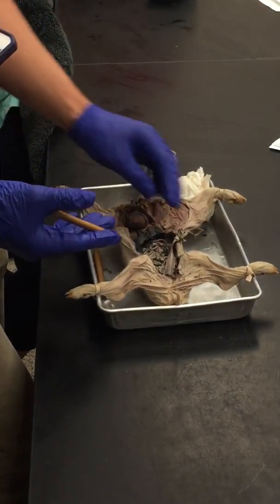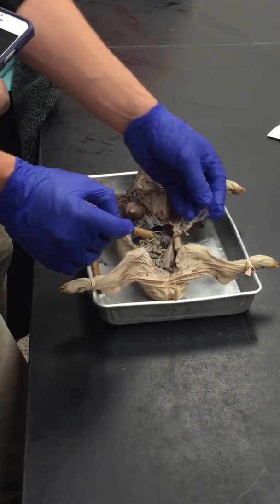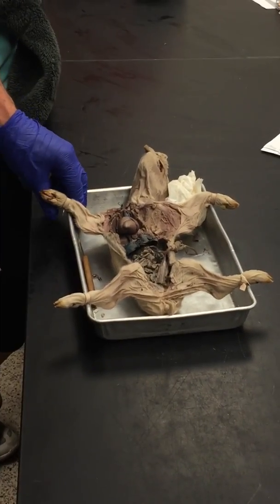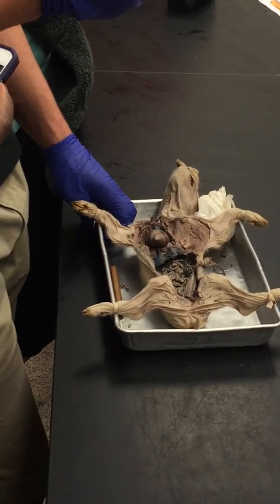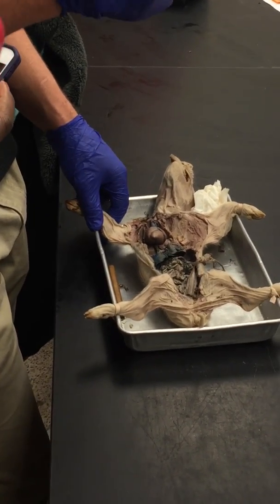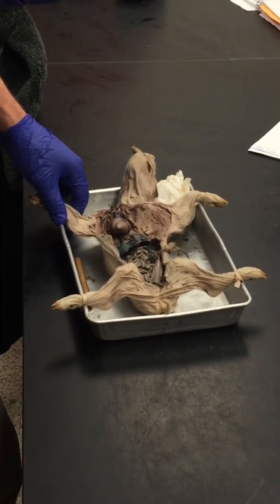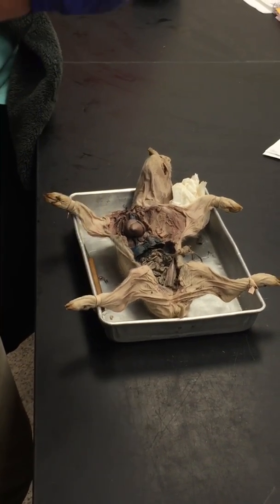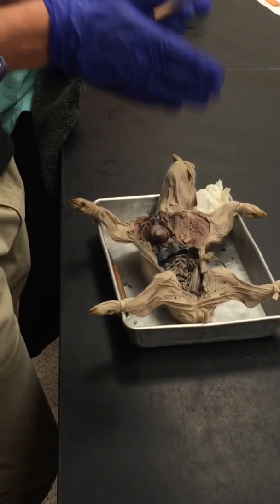So for the fetal pig, for the most part, if you can recognize the umbilical cord, umbilical vein, umbilical arteries, urinary bladder, and then just understand what the ligamentum arteriosum is with the ductus, and what the ligamentum arteriosum is, what it used to be, as in the ductus arteriosus, then understand what the ductus venosus does. And all of that should be on the back page of your worksheet. It should explain what it turns into and what its job is. So on the practical, those conceptual questions are fair game, but the answers are already there, you don't even have to write them down.